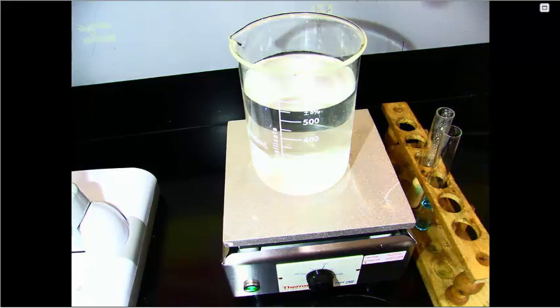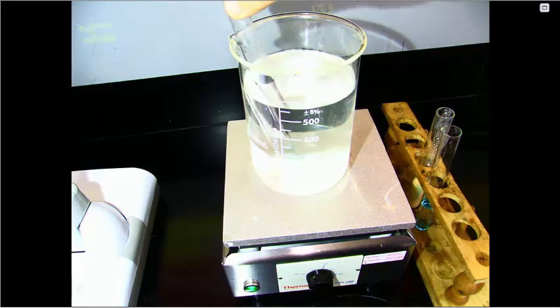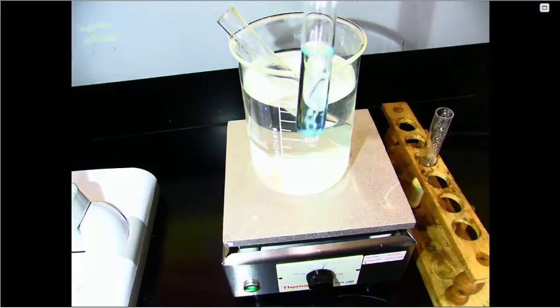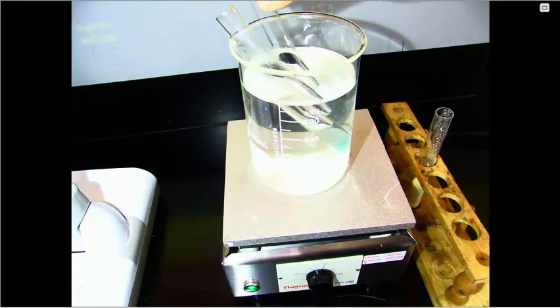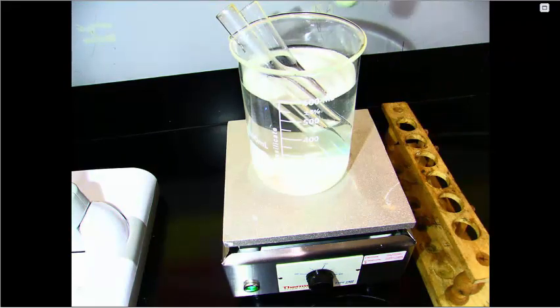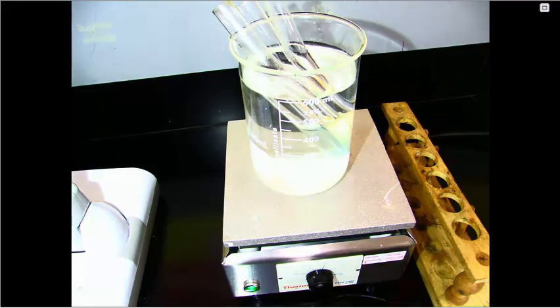Right, so we have our glucose solution going into the hot water bath. Then we have the water solution, and finally the McMush solution. We will let that sit in the hot water bath until a reaction takes place.